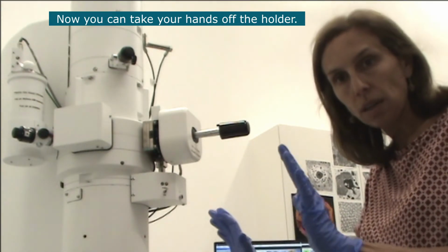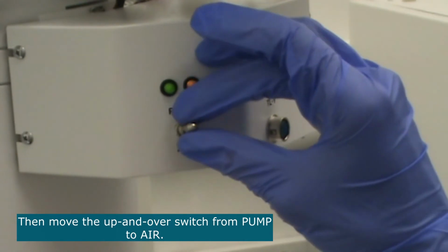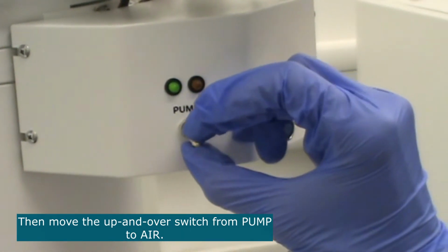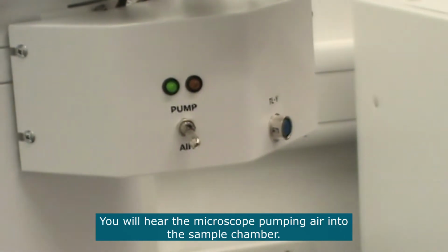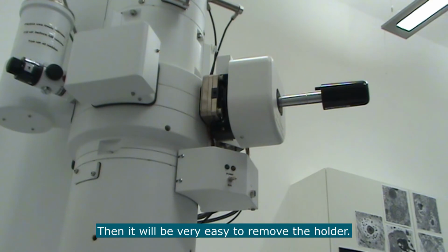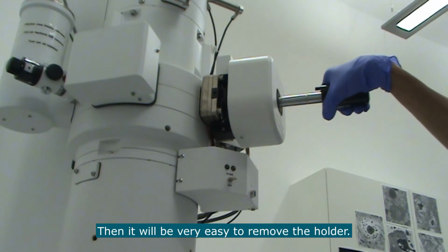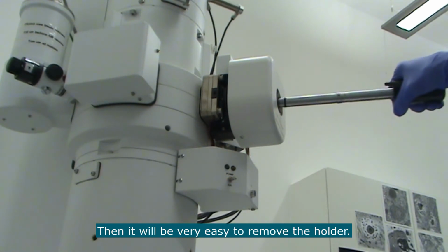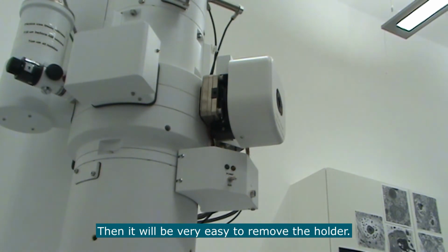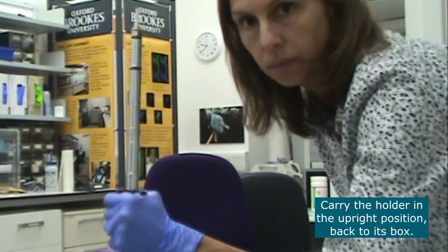Now you can take your hands off the holder, and then you move this up and over, switching from pump to air. And then it will be very easy to remove the holder. Carry the holder in the upright position back to its box.